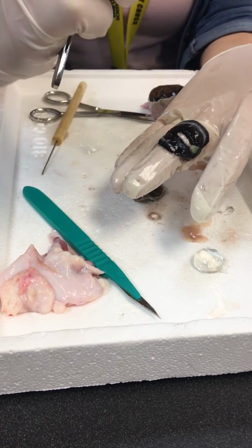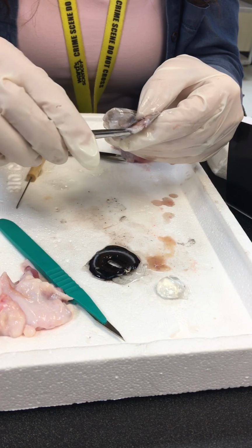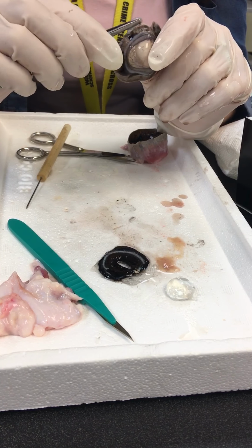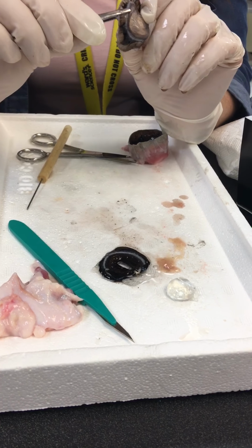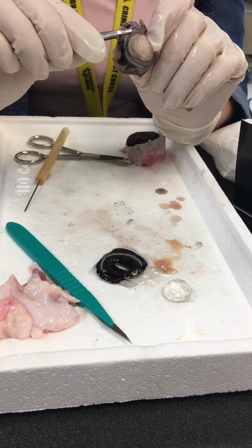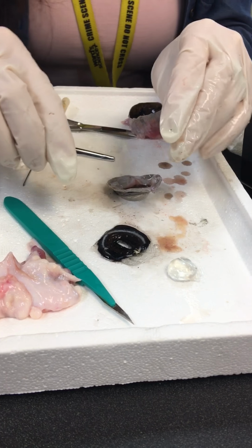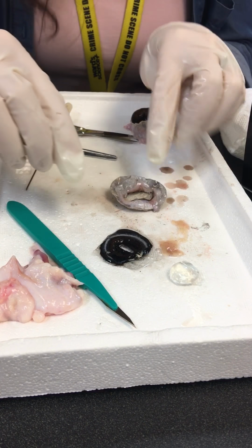All right, so then what we have left, what is this layer here? The outside layer? Cornea. Okay, so you're going to have some aqueous humor there as well, okay? It had obviously lost a little bit of aqueous humor, but you're doing really good, Elizabeth. I'm so proud of you. Okay.